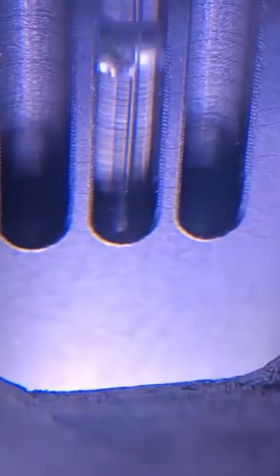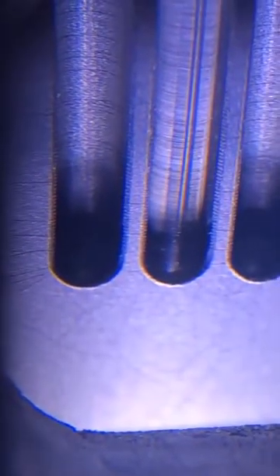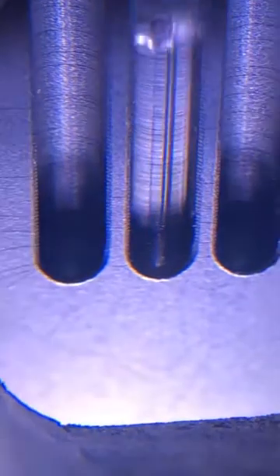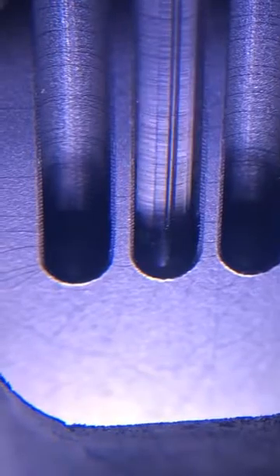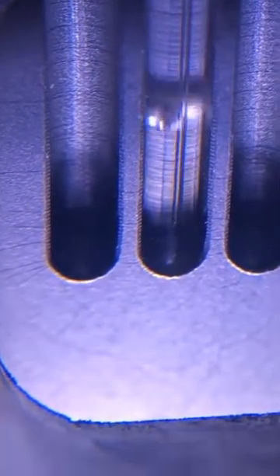These bubbles will keep coming out as toluene vapor continues to be generated at the face of the tube and displacing air. So as it displaces air, you'll see these gas bubbles coming out. You see it's going fast, 107, but it's not nearly what it will be when it's at the boiling point.